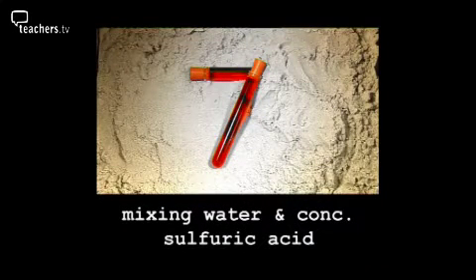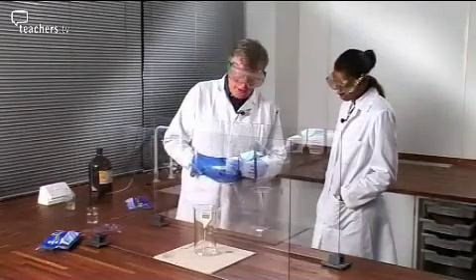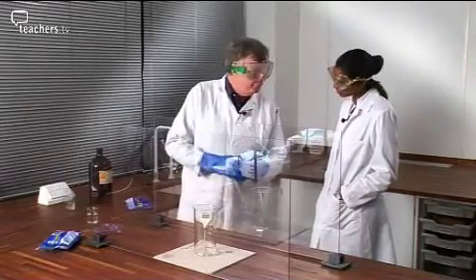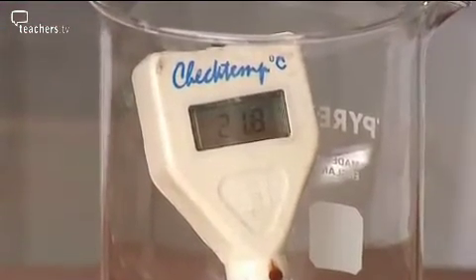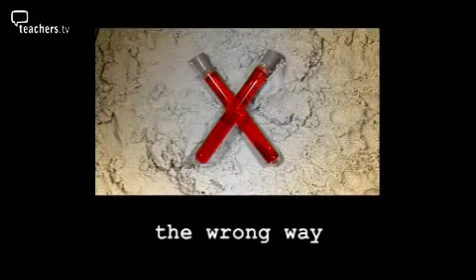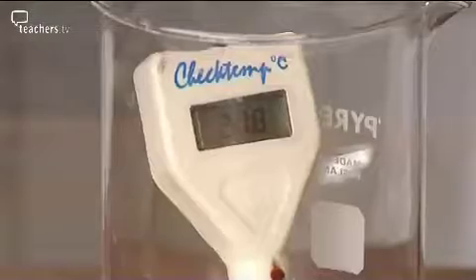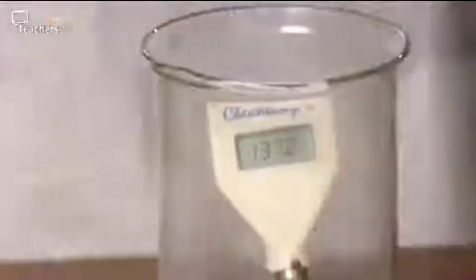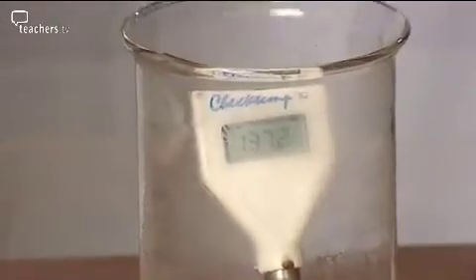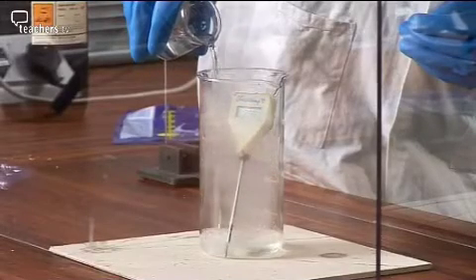At number 7, never add water to concentrated sulfuric acid. I have a tall form beaker here with about 1 centimetre depth of concentrated sulfuric acid. I've put a digital thermometer in the beaker. So now we're going to add a similar depth of water to this. The acid starts at room temperature. Wow. Gosh. 137? Yes. Wow, that's really hot. In the worst scenario, this can actually blow out over people.